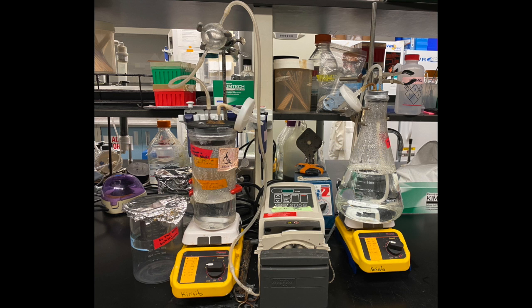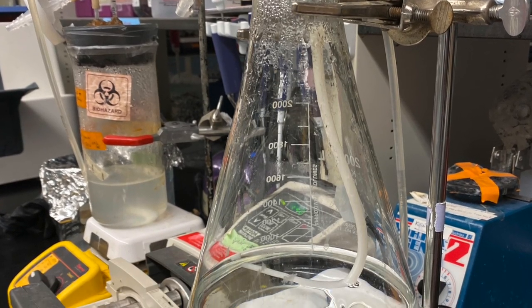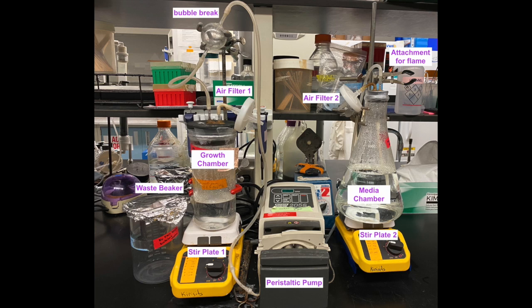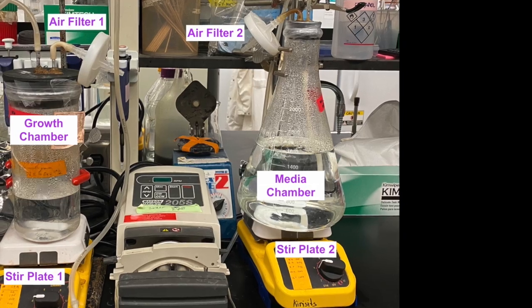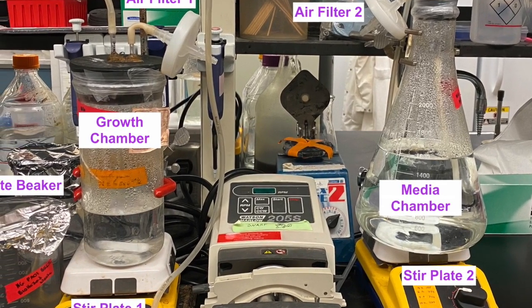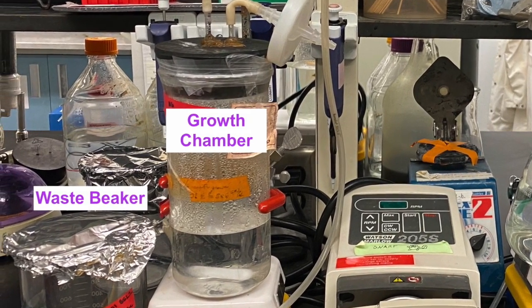Chemostats are biological CSTRs which are used to maintain a stable continuous culture volume of a target microorganism for research. Let's start by labeling the parts of the chemostat. Most importantly, we have the growth chamber, and this is where our target organism lives. This specific chemostat is culturing Pseudomonas aeruginosa.